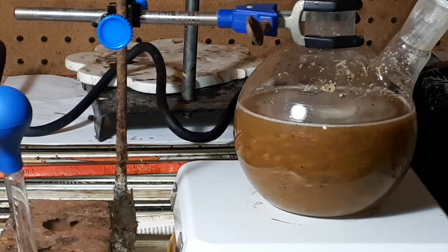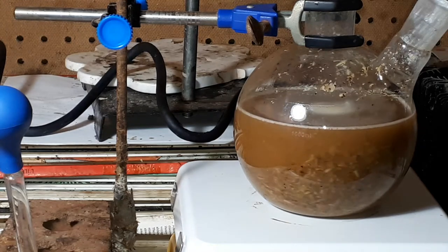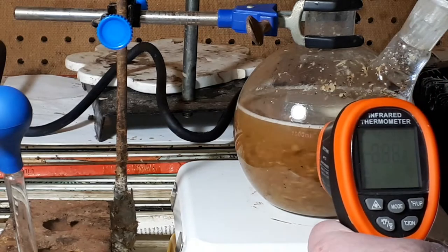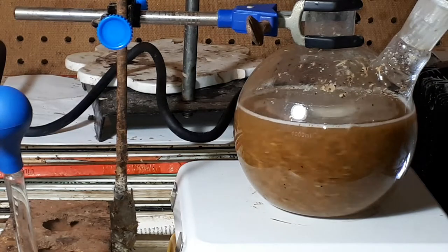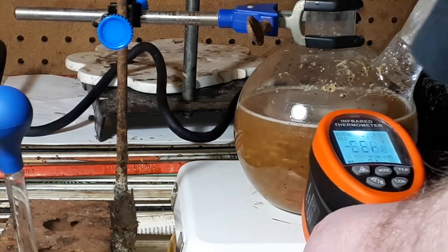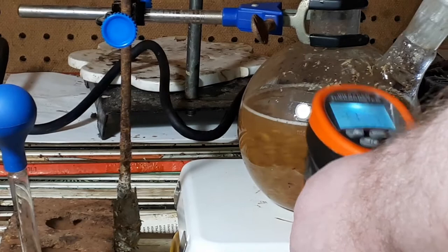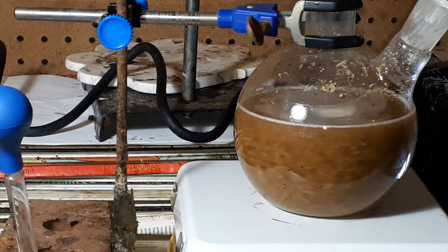If I take off this stopper, I can really smell the potent licorice extract even a few hours into it. I will test the temperature — see what temperature it is. It reads 72 degrees Celsius. The hot plate is up to 200 degrees Celsius; it is fluctuating because of air movement from the stirring.